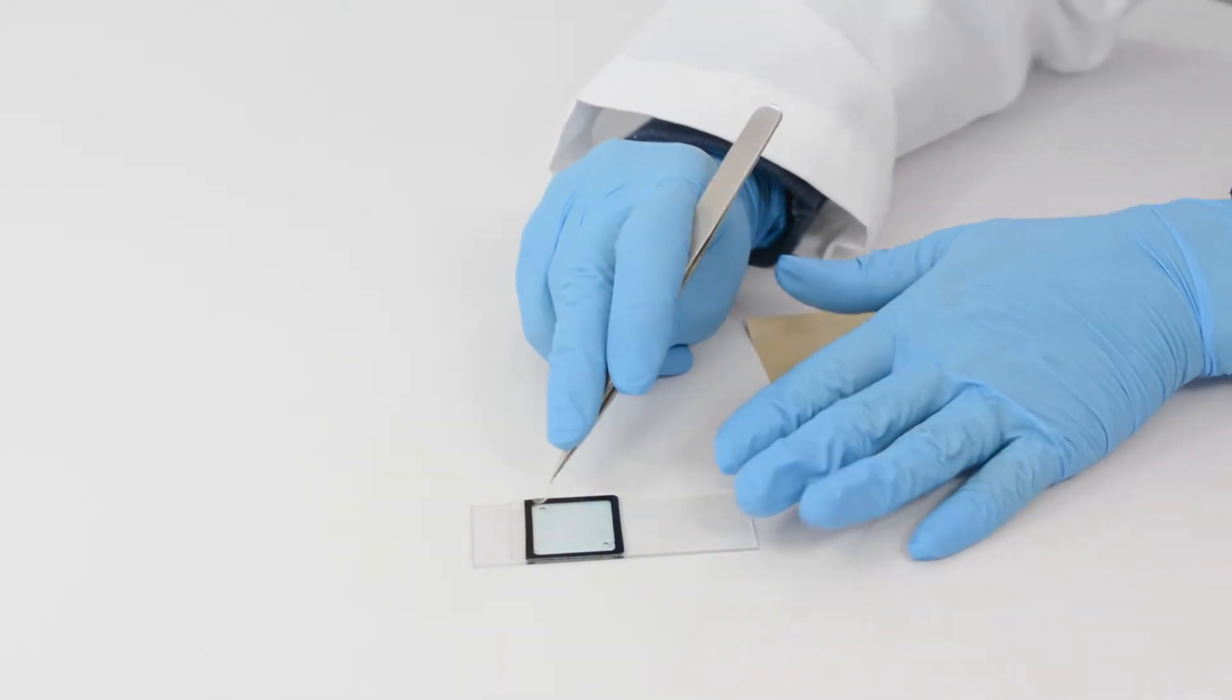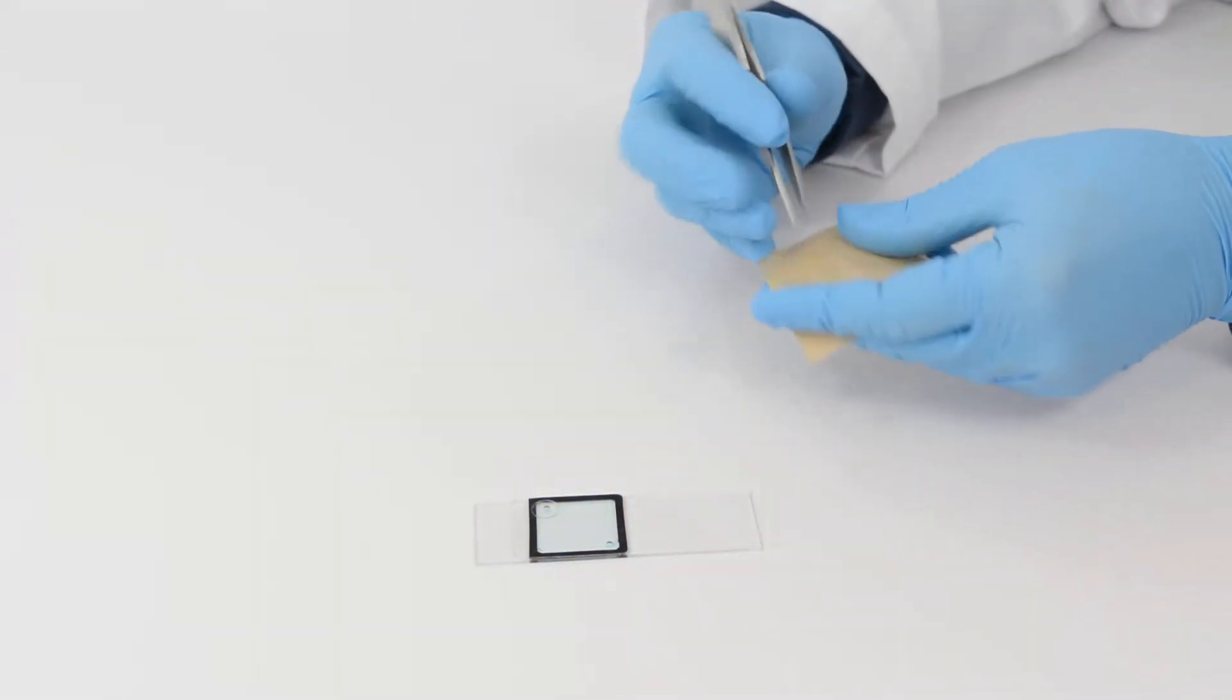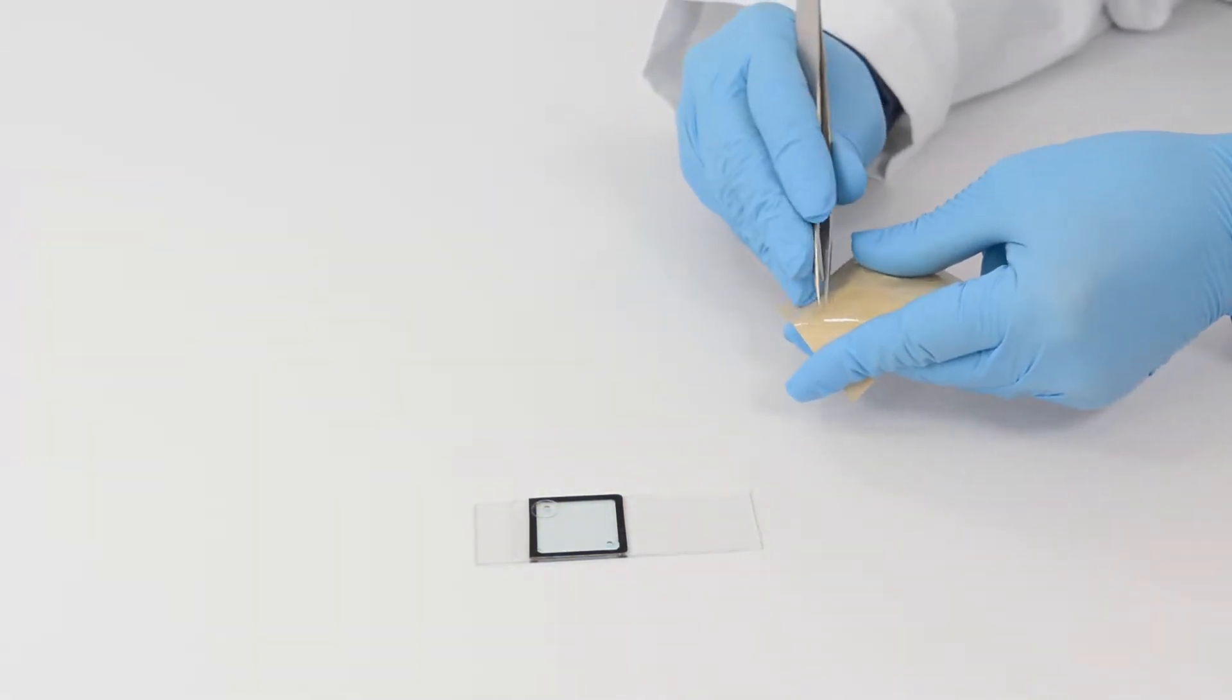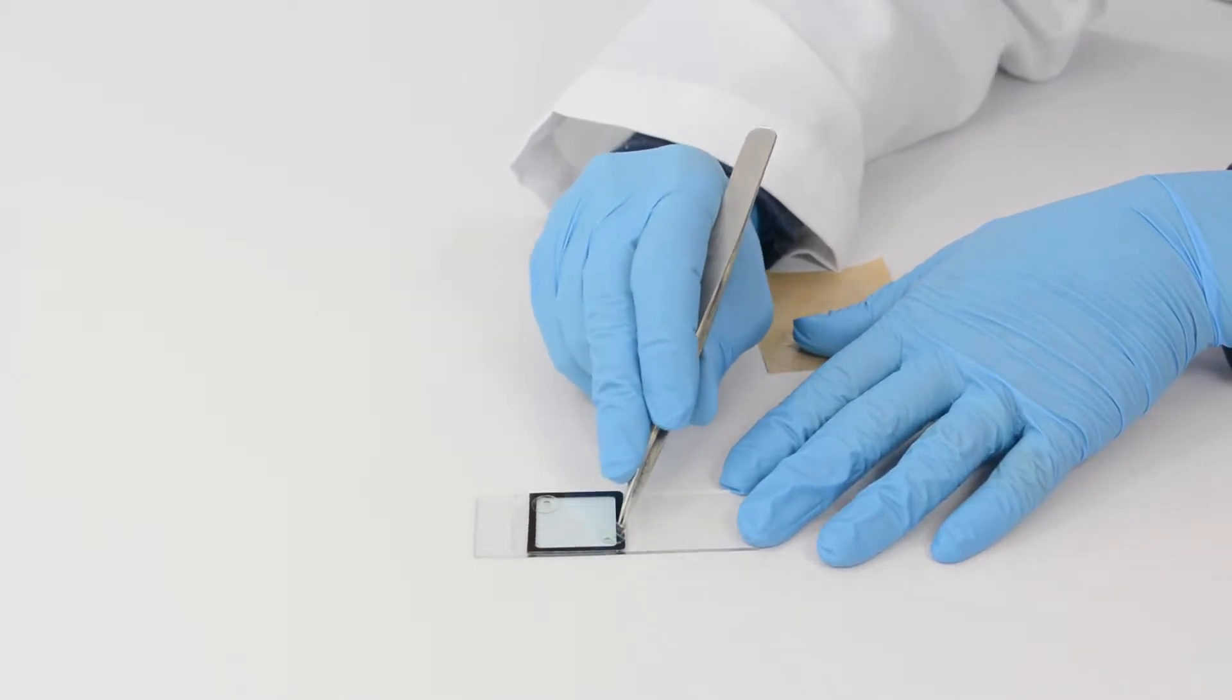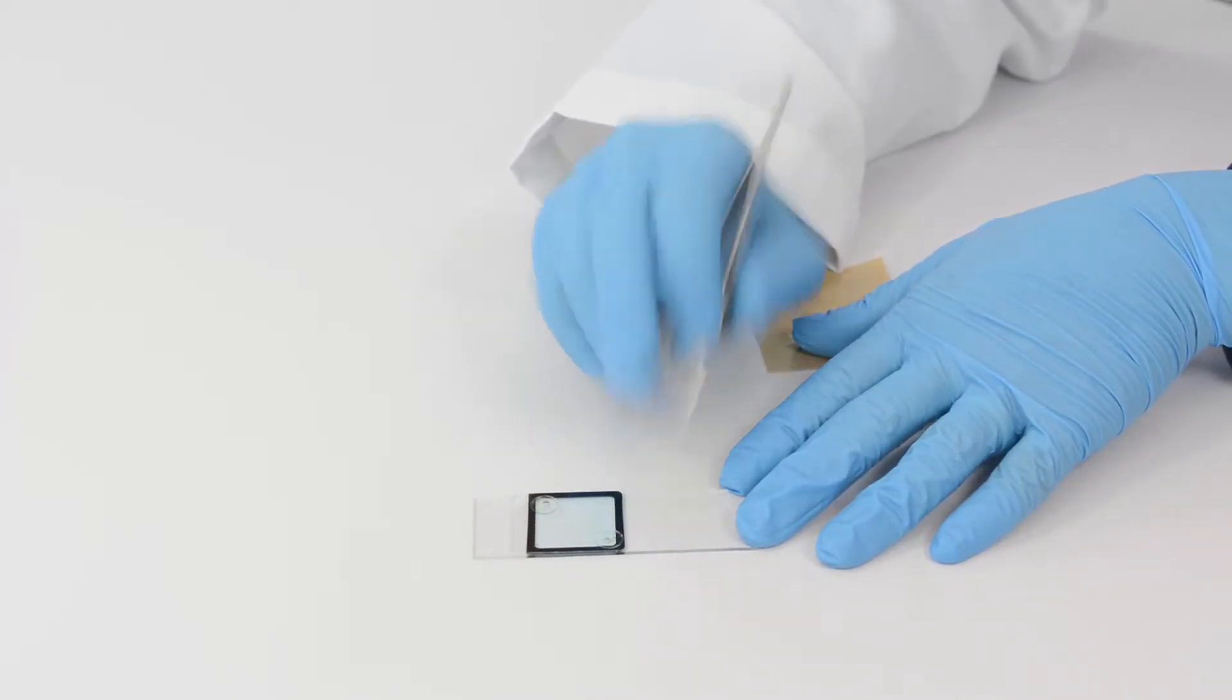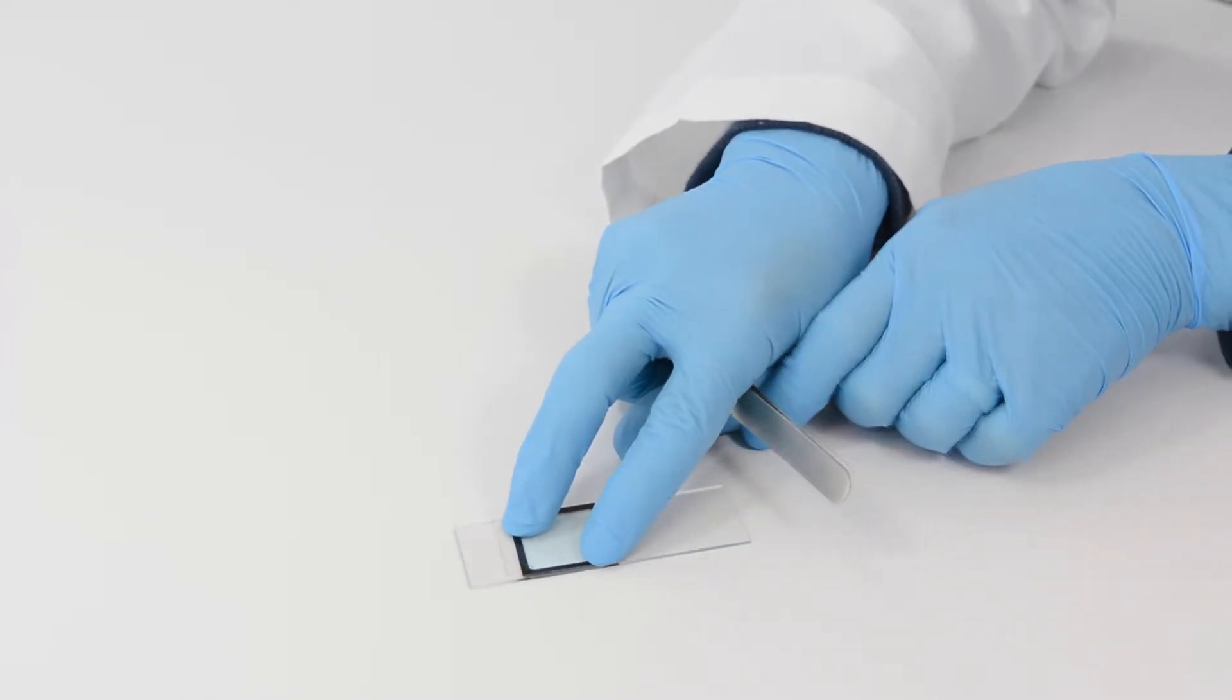Place seal tabs over the ports. Press for 10 seconds to achieve an optimal seal.